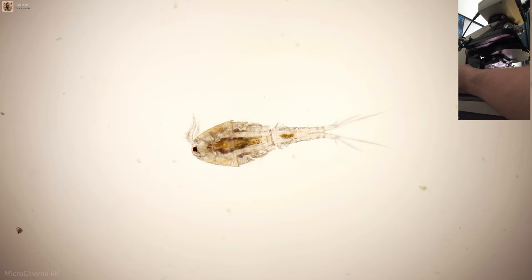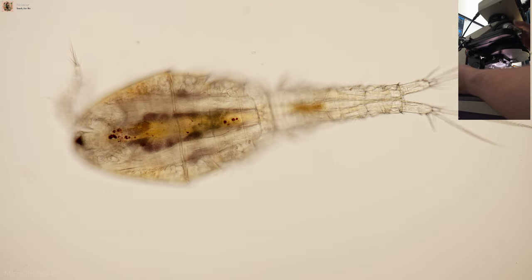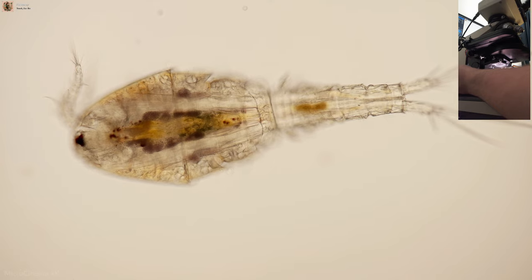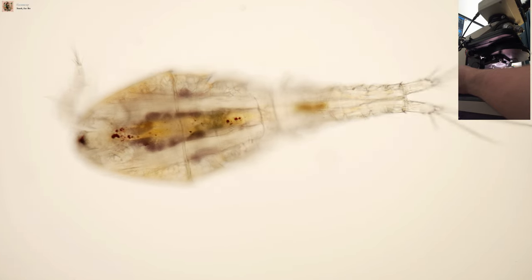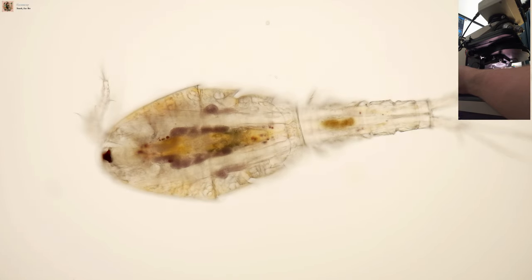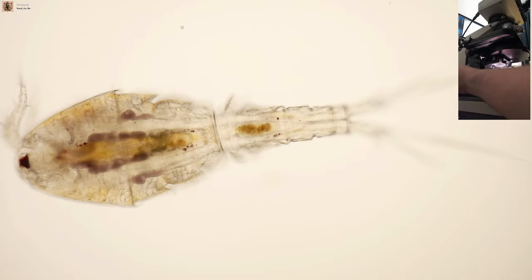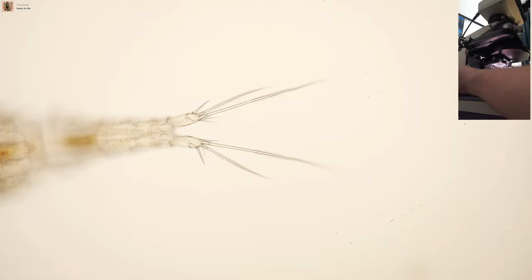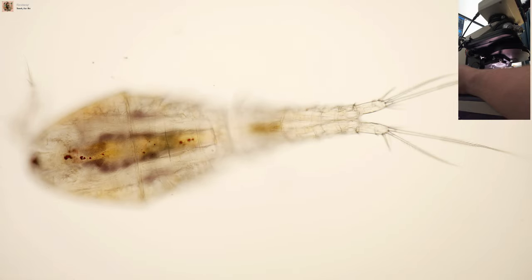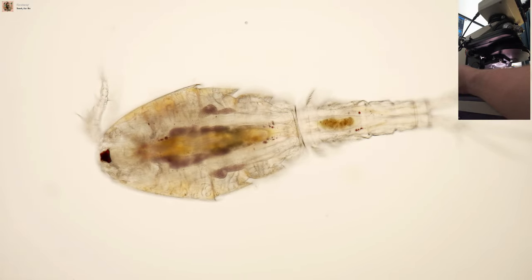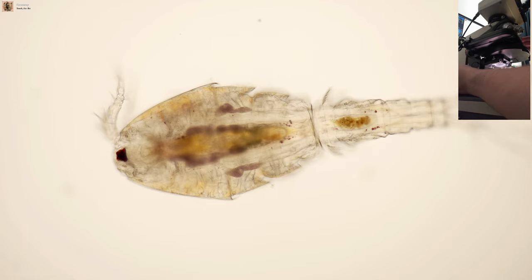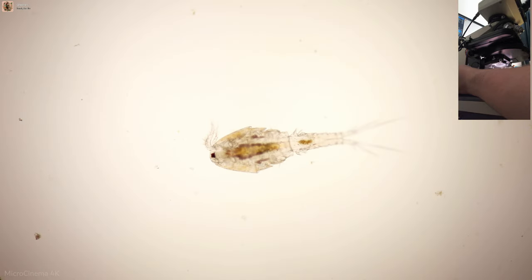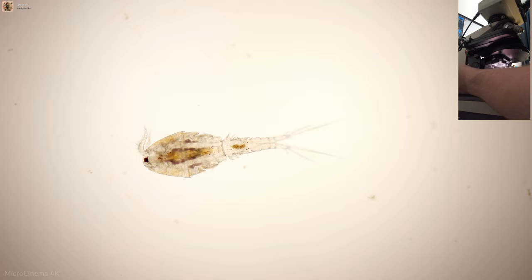And so it's always been really rough. Any time that I want to film copepod in dark field, I have to actually take my condenser off and the stream goes silent for a while as I fiddle around with everything. And I figured out actually a really cool way to just sort of circumvent this.